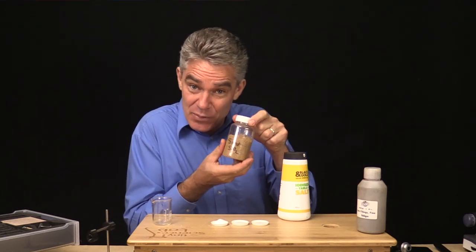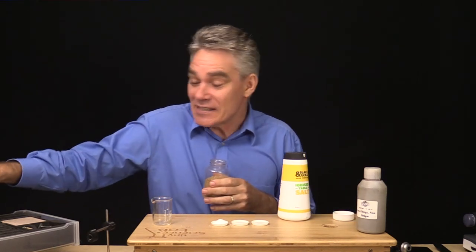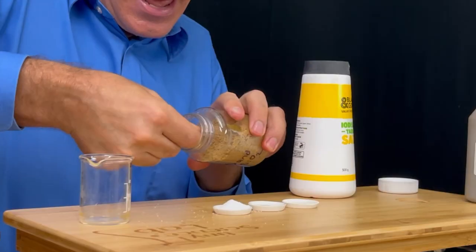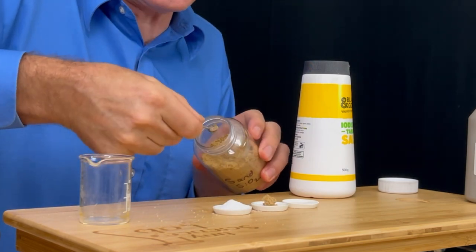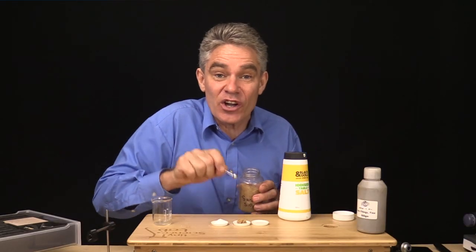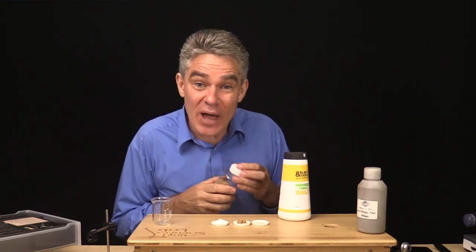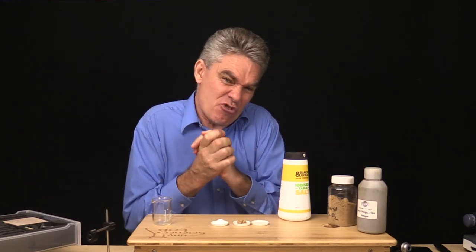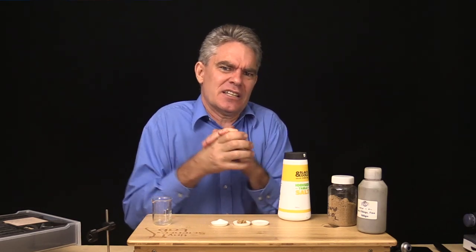Sand is another pure substance. Sand is silicon dioxide. Let me get some silicon dioxide out of this container — I'll just use my spoon and scoop some up. It's also a crystalline substance. The compound is silicon dioxide, SiO2 — one atom of silicon combined with two atoms of oxygen, bound together in a really strong chemical bond. Very hard to pull the silicon and the oxygen apart.